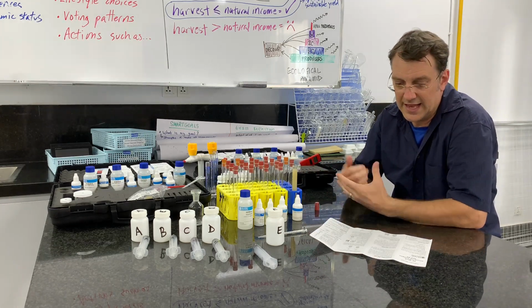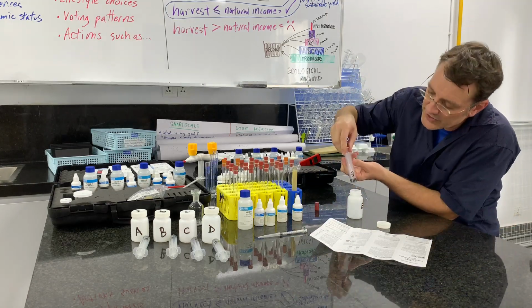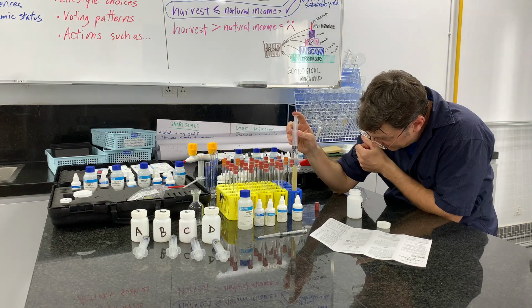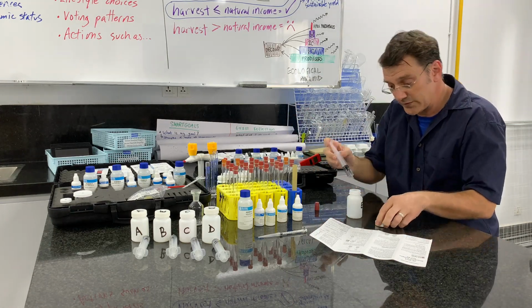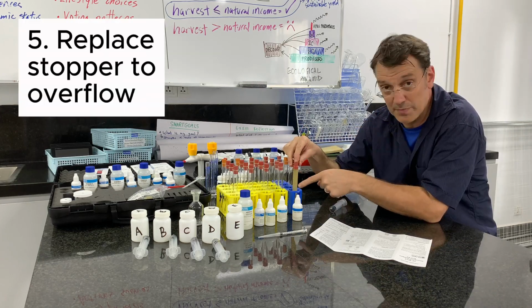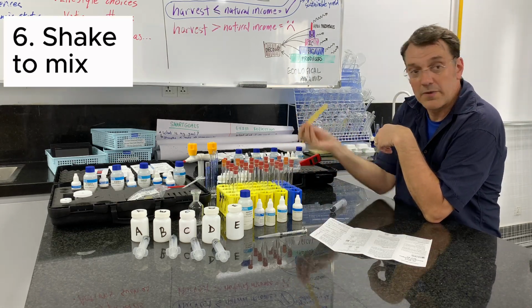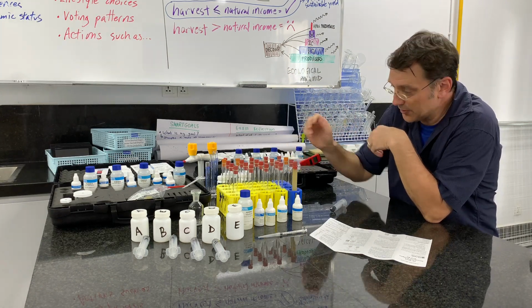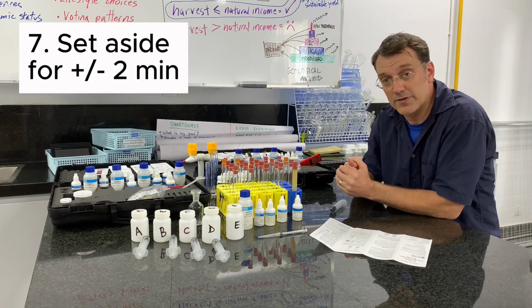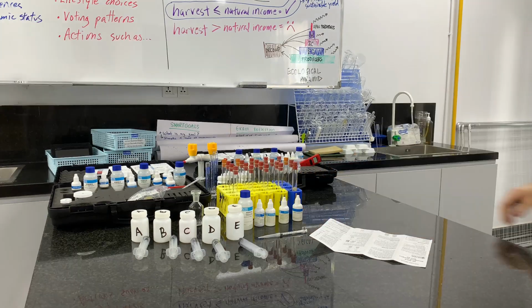Now, I don't know if you can see this on the camera or not, but a precipitate has begun to form. Next step, add a little bit more of your sample, and here's where this syringe comes in handy. I've got some of my sample in here, and I'm just going to add it until my test tube is full and overflowing a little bit, then put your stopper back on so that it spills over again a little bit. You might want to do this on paper towels. Then I'm going to mix it a little bit. I'm going to put it back. I've got this cloudy solution, and I'm going to let it sit for a couple of minutes until that precipitate begins to fall to the bottom of the test tube.